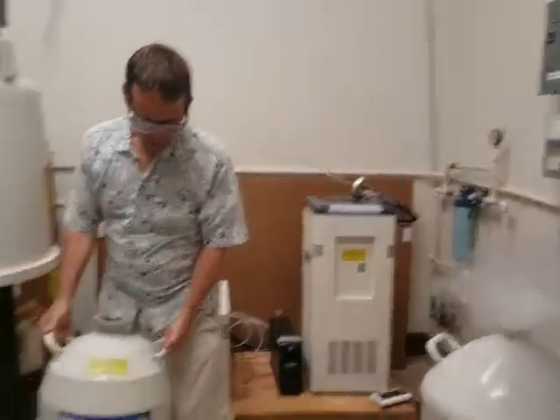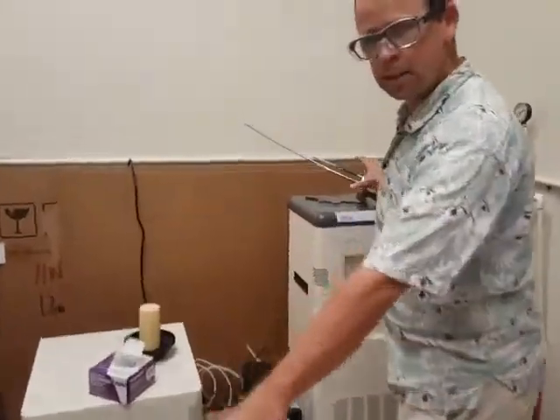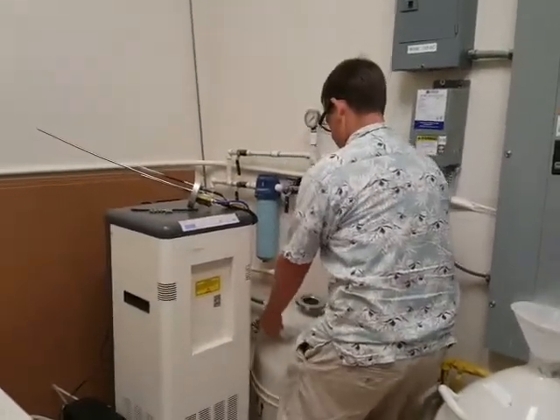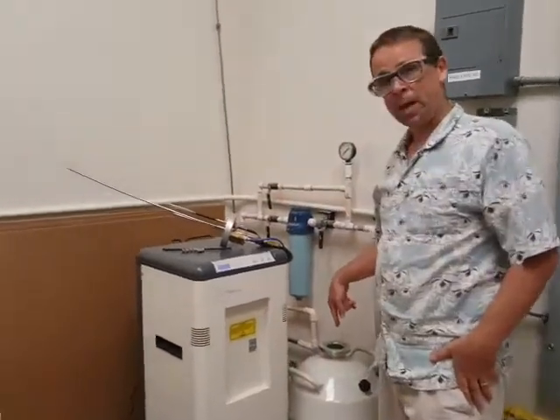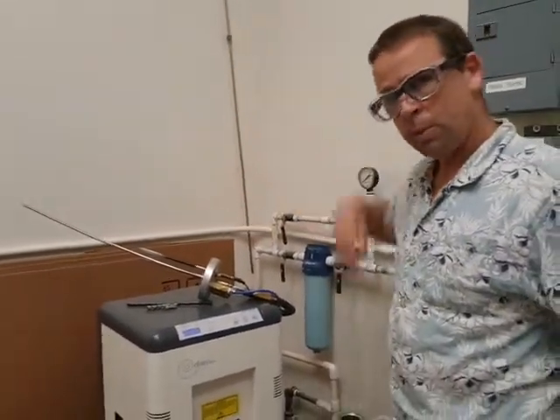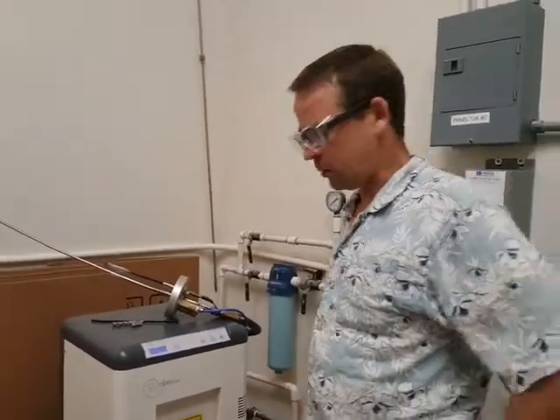The other thing I want to show you is that when you go to put this thing back — it's going to go back over here in the corner — it's best if we can remove all of the moisture off of this so that when we put it back in, these parts don't freeze solid with water and prevent transfer of liquid nitrogen.